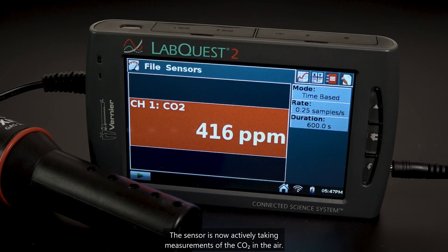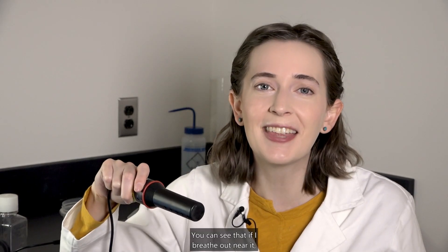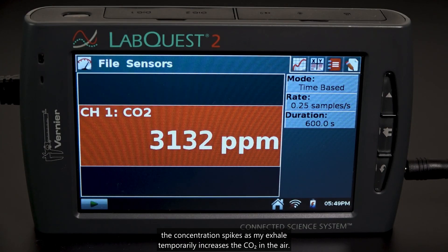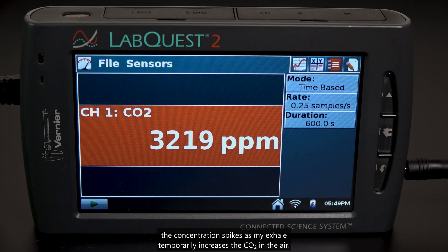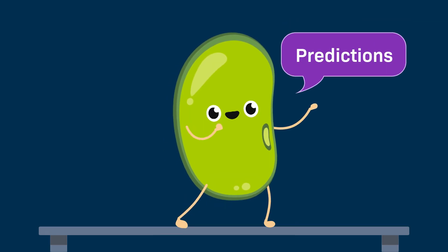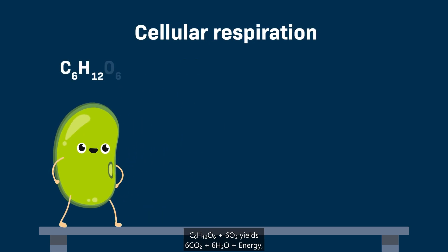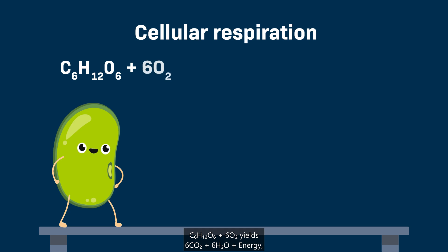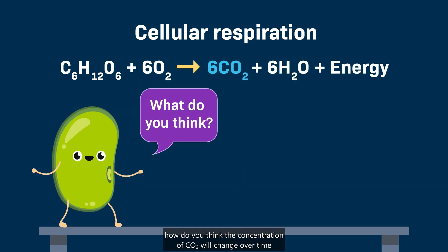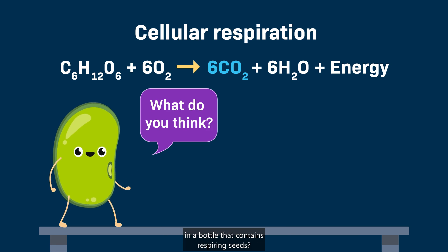The sensor is now actively taking measurements of the CO2 in the air. You can see that if I breathe out near it, the concentration spikes as my exhale temporarily increases the CO2 in the air. While we wait for the reading to go down again, let's make some predictions. If the chemical equation for cellular respiration is C6H12O6 plus 6O2 yields 6CO2 plus 6H2O plus energy, how do you think the concentration of CO2 will change over time in a bottle that contains respiring seeds?